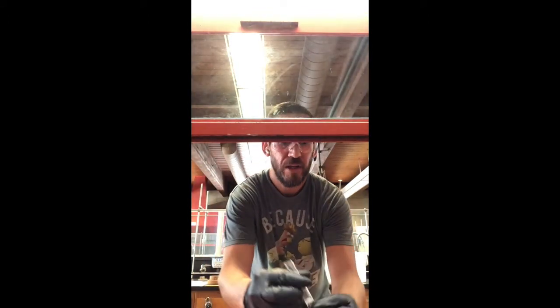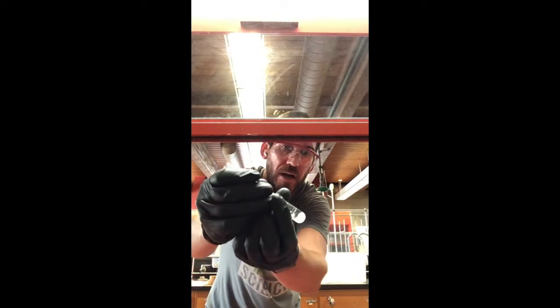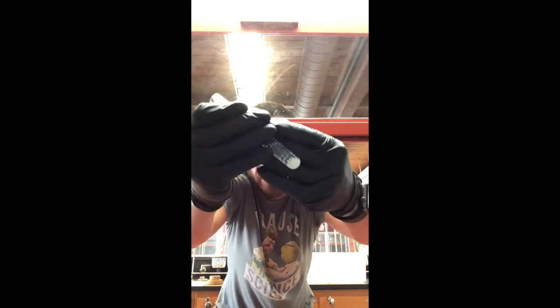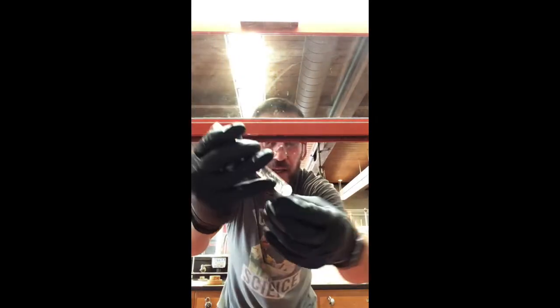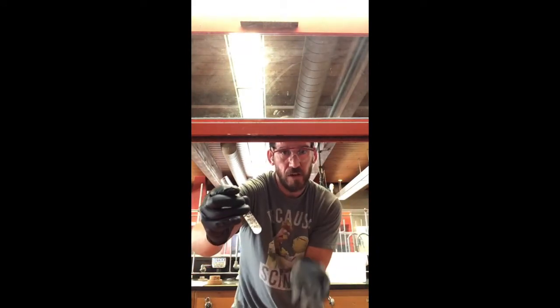All right, so I added a little bit more, just because you know how to pour things, right? And I like the way it's looking now. It's kind of difficult to see in the video, but we can see some clumps chilling on top, right? Other than that, right below it, because the bigger stuff's going to come to the top, the small stuff's going to go to the bottom, right?